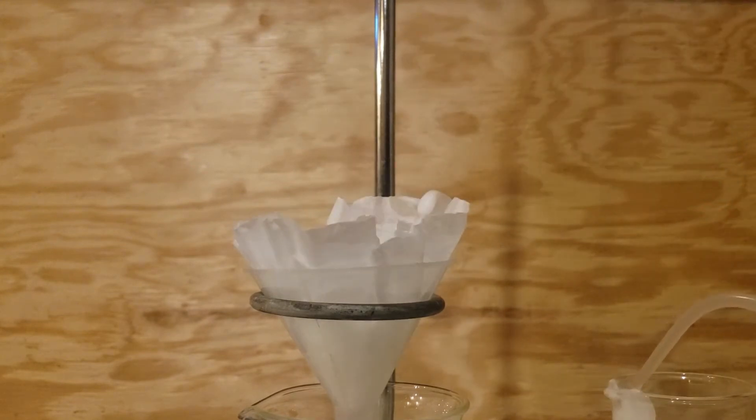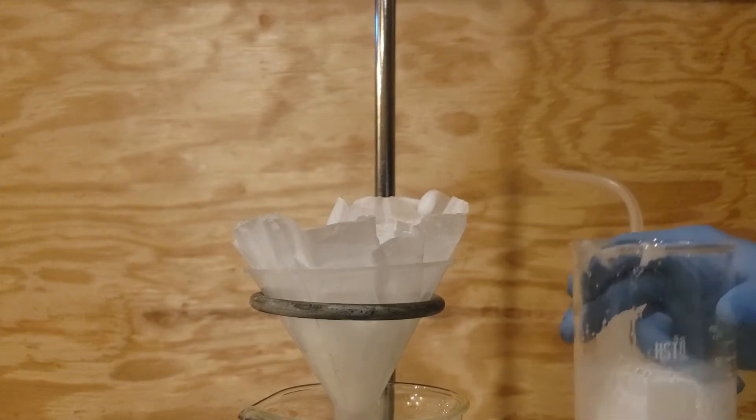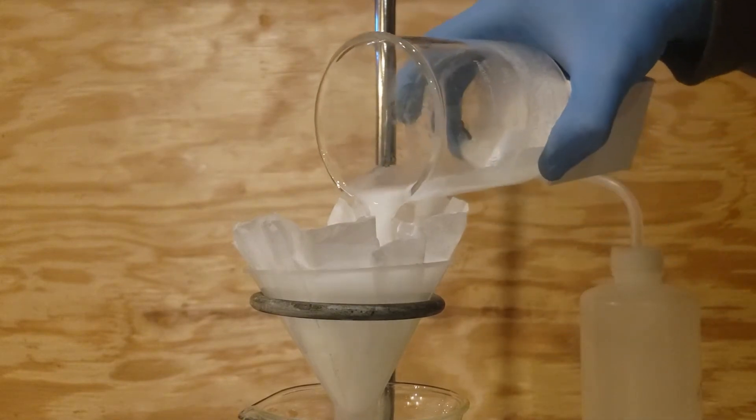After it was done filtering, I washed the beaker out with a little bit of cold water and added this to the filter funnel.